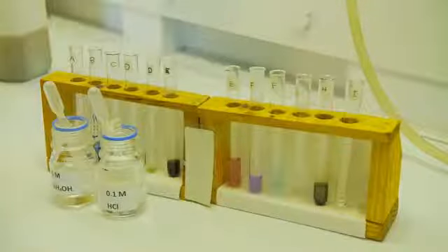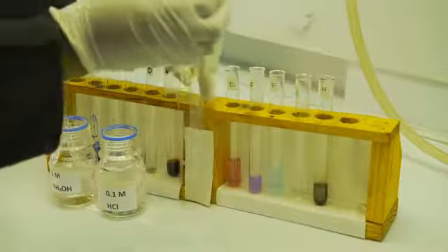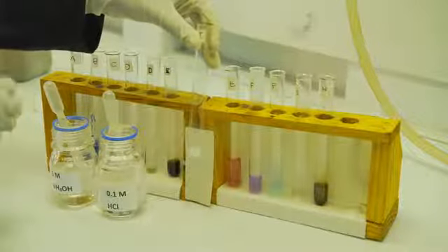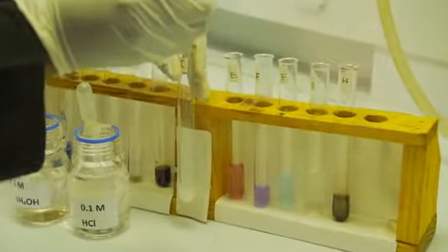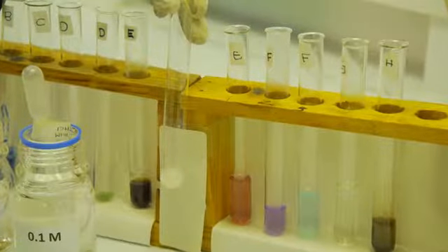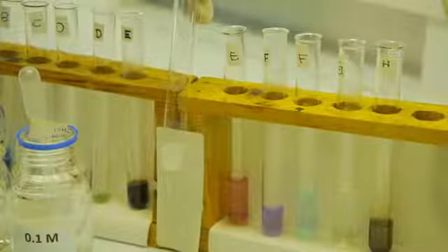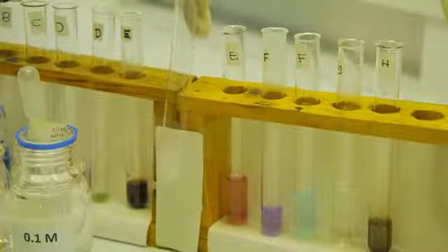To confirm the presence of silver cations, I will add 3 drops of dilute hydrochloric acid to 1 ml of the cation solution suspected to contain silver. Formation of a white precipitate indicates the presence of silver chloride. To further confirm that silver is present, I will add 5 drops of dilute ammonia. The precipitate should dissolve; if it does not, more drops can be added until the precipitate dissolves. Dissolution of the precipitate indicates the formation of a silver ammonium complex, confirming the presence of silver cations.